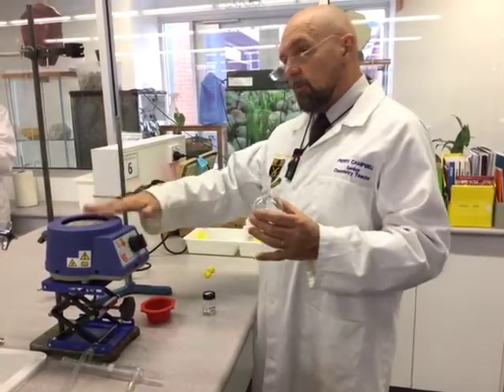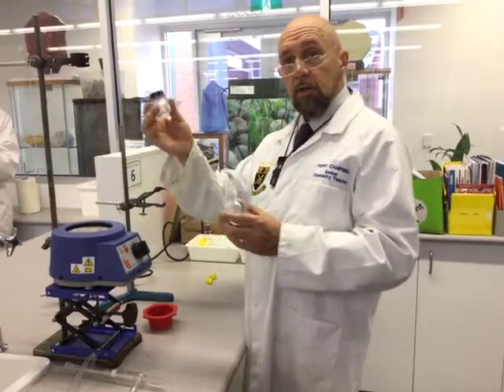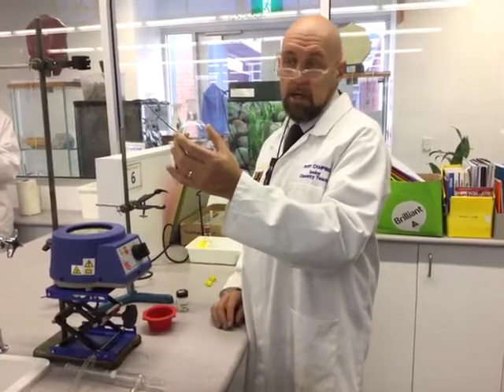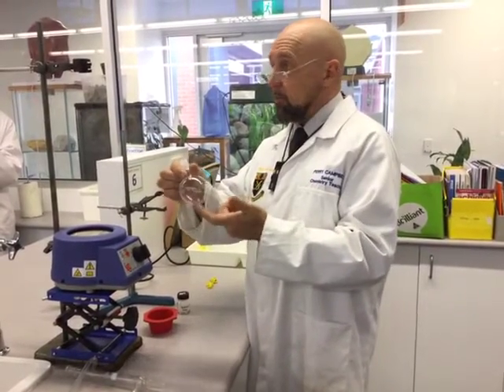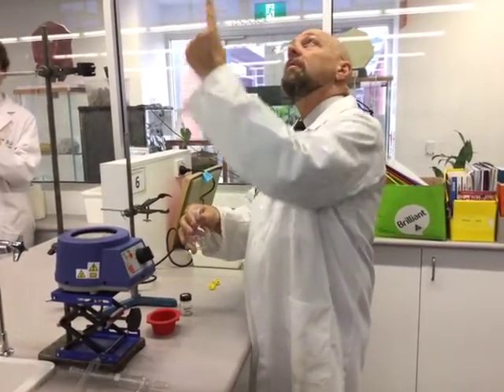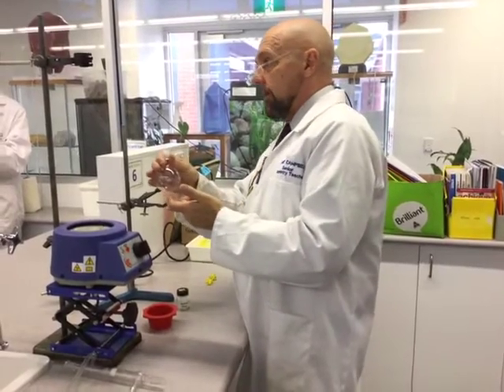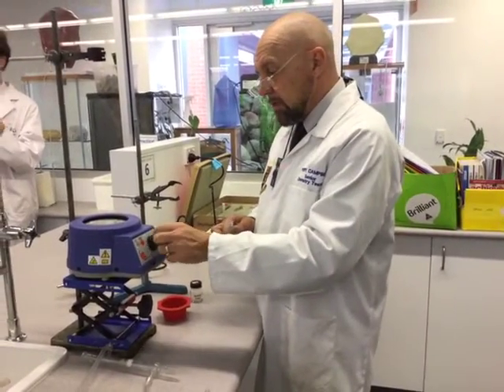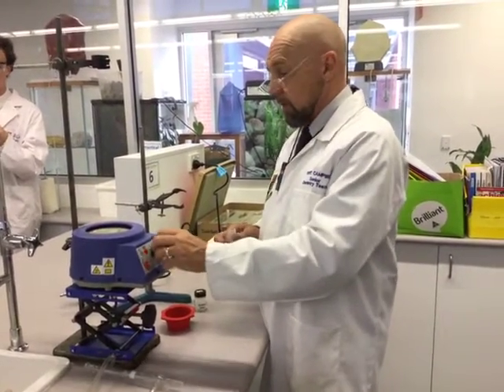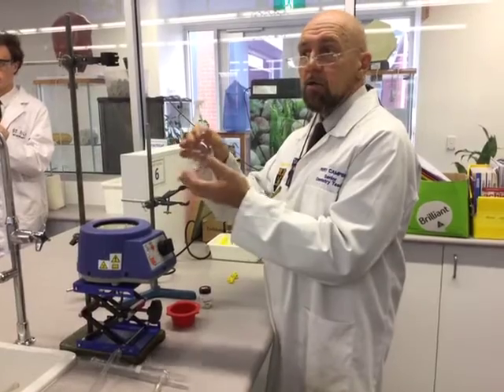You always start typically from the base and work your way up. You are supplied with boiling chips — put one or two, probably one is plenty, into your round bottom flask. That ensures even boiling and won't allow the mixture to superheat. We don't want it to suddenly boil and shoot straight up through the top of the condenser. It just allows things to boil consistently. The temperature we tend to set at about seven or eight to start, and you might need to back it off or turn it up depending on the rate of boiling — we want a steady boil during reflux.